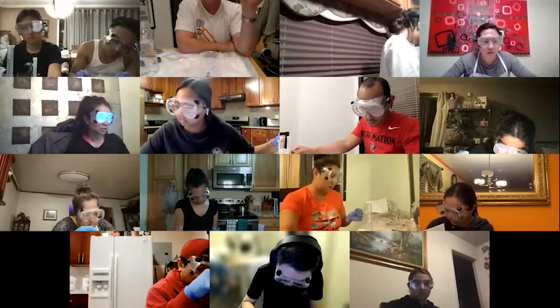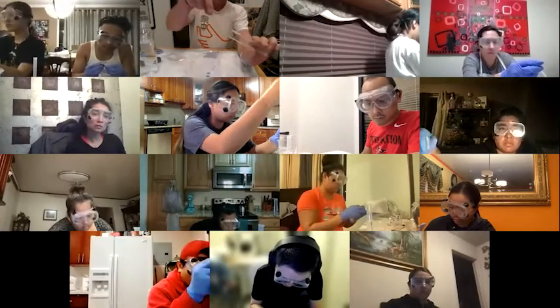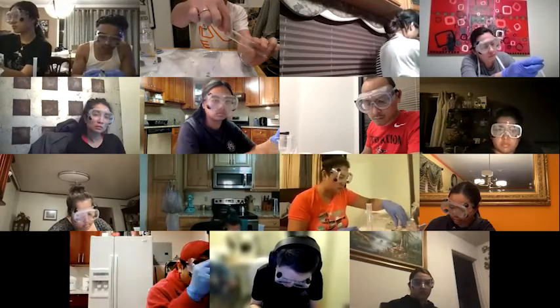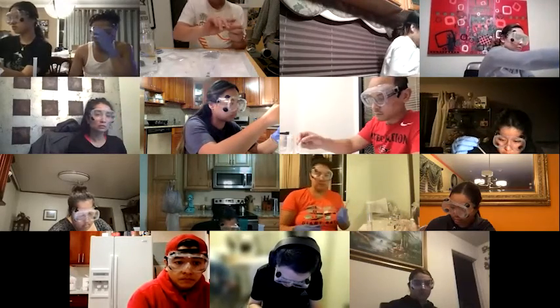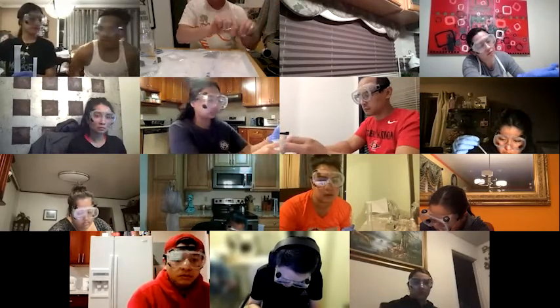The stopper we use is the smaller one, right? Yeah, it should fit in the glass tube and it should have a hole in it. So Professor, just continue adding water until it fills the small tube, right? Yeah, so first you put about 3 mL of the 1 molar HCl and then tip it to the side and then slowly add water to it. Try not to mix the water and the HCl too much. The idea is you want the dense HCl to keep together so that when you turn it upside down, the denser HCl will sink to the bottom and then start the reaction.